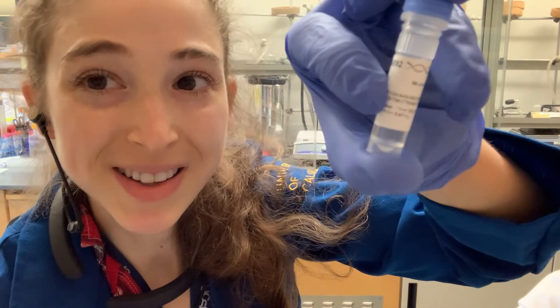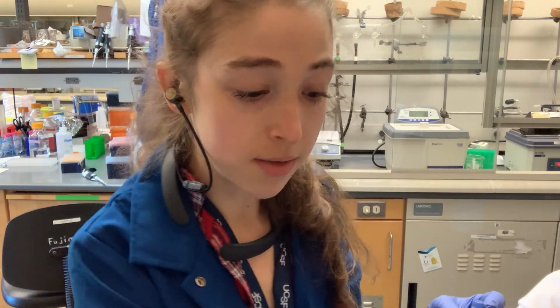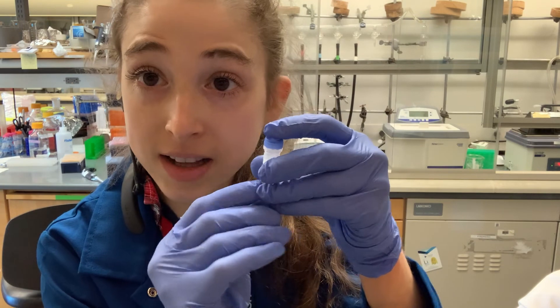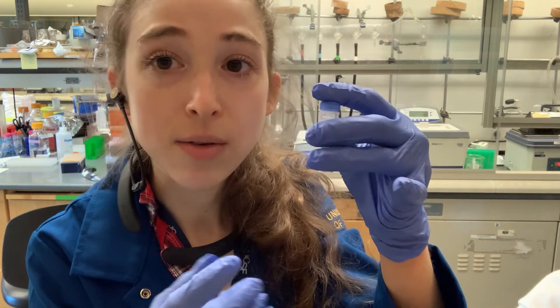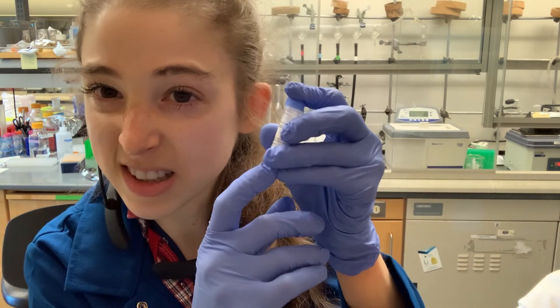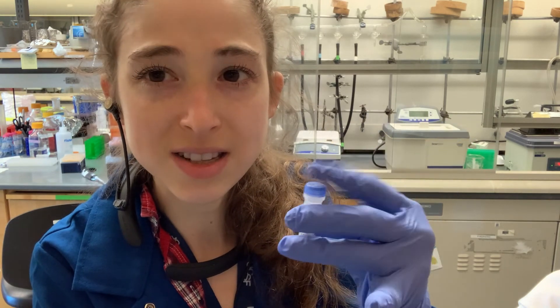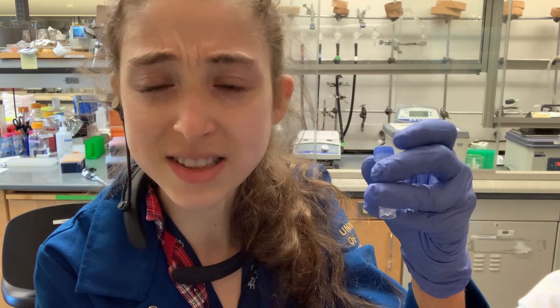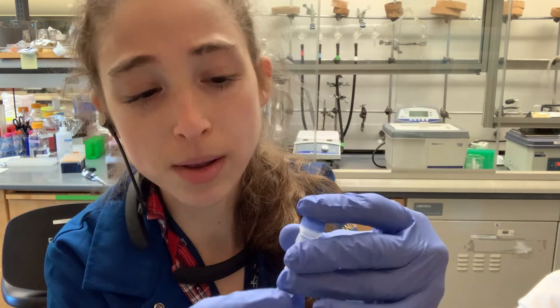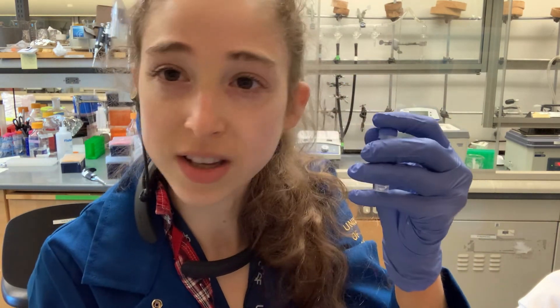The tube arrived — it tells me there are 25.7 nanomoles in here. So if I add 257 microliters of my Tris buffer, that will get me to 100 micromolar. Typically I add the liquid, let it sit for a few minutes to re-dissolve, spin it first, then pipette up and down to make sure it's all mixed. If you see a little bit still stuck, try a quick vortex. If stuff is still stuck, it's probably not your DNA or RNA — it's synthesis byproduct — and you can move to a different tube or do column purification.